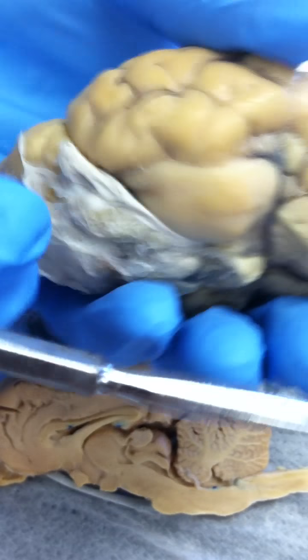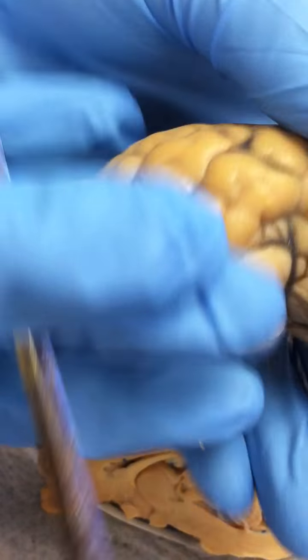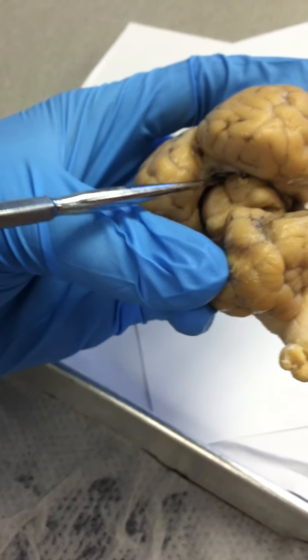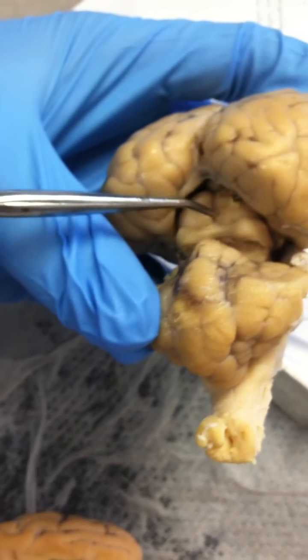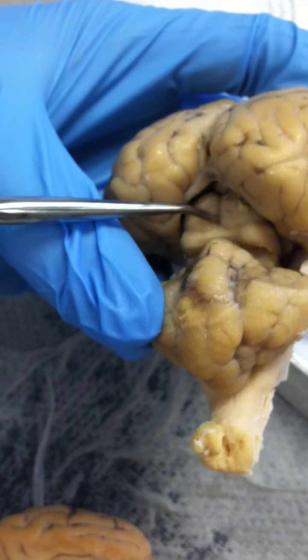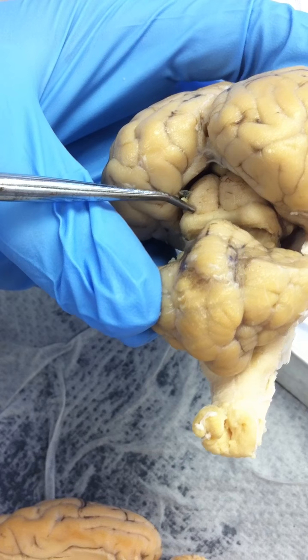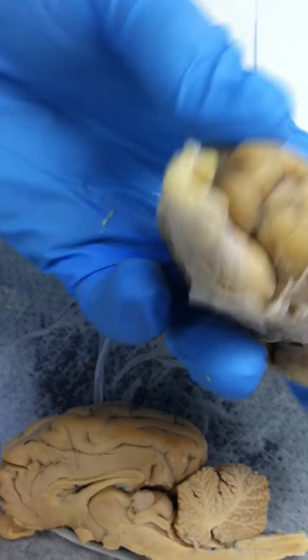The pituitary gland is right here, above the dura mater. Then the pineal gland is right over here. You see the butt cheeks, right above it, right there. Then we have the superior colliculi, which are the actual butt cheeks. Under that, the inferior colliculi, right under the butt cheeks. All together, they're called the corpora quadrigemina, the four twins. And that's it.